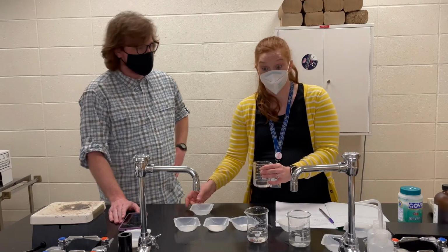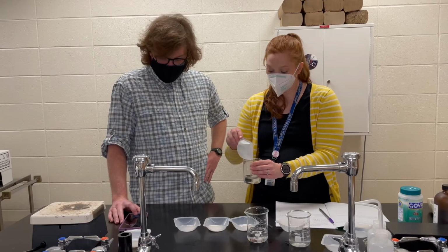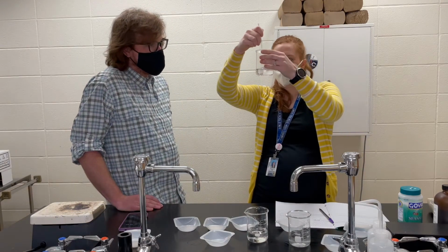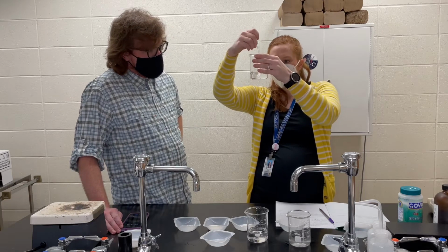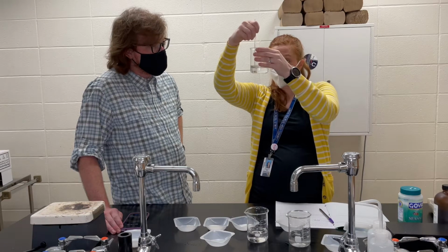This is our large crystals this time. Are you ready? Yep, when you are. Now, I'm noticing immediately that there's only like 5 crystals, maybe 5 or 6. One is particularly large, so we're going to have to see what happens with this large crystal. Now, it is getting smaller.